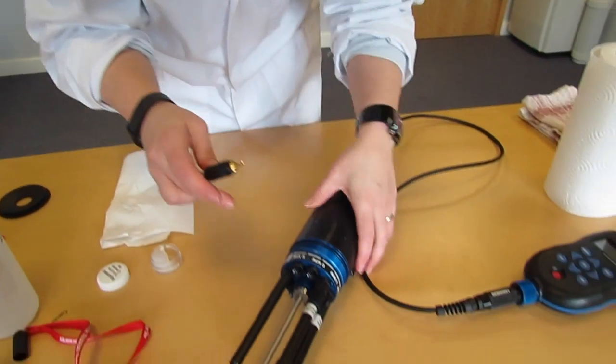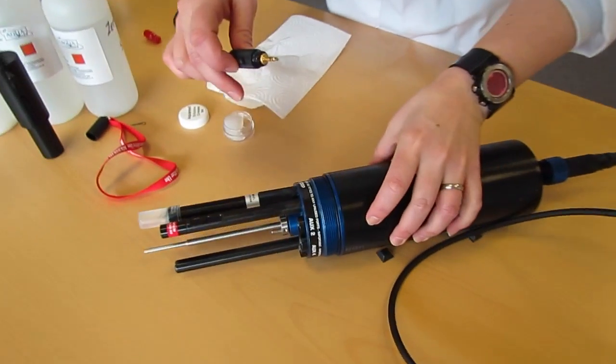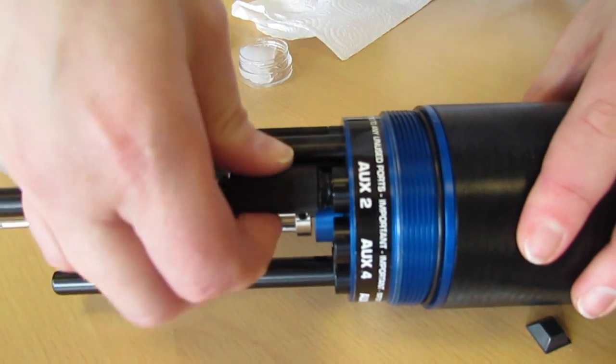This can then be inserted into any free aux socket, so I'm going to insert it into aux 2.